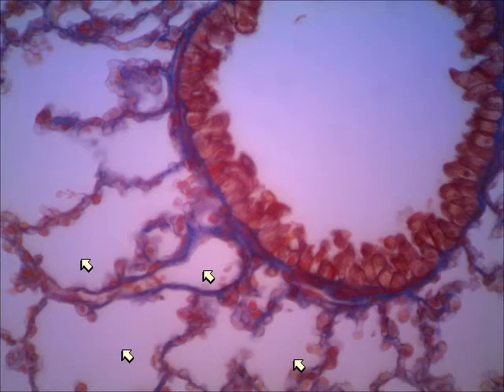Okay, so the lung slide is actually very easy to recognize. You see the big open alveoli lined with the simple squamous epithelium, and then you see the bronchioles, which are other openings that have a thick, wavy lining. I've always thought that these two slides were probably some of the easiest ones in A&P 2 because they have these distinct tissues that you're looking for.